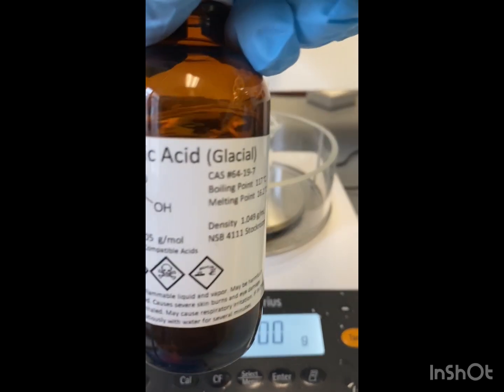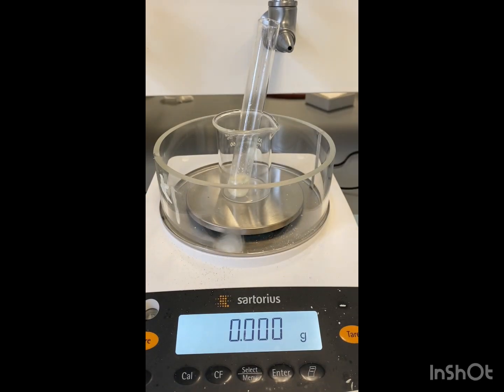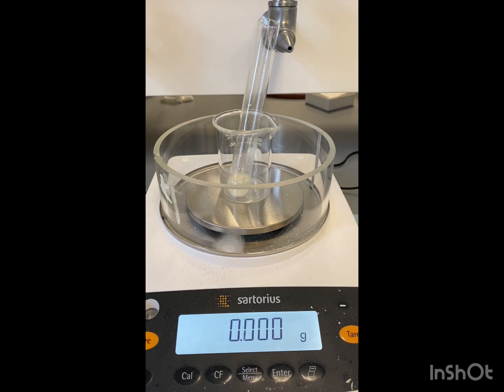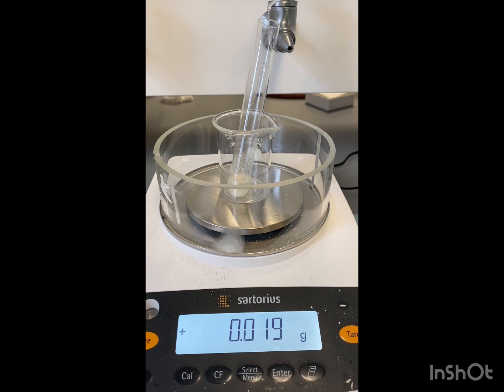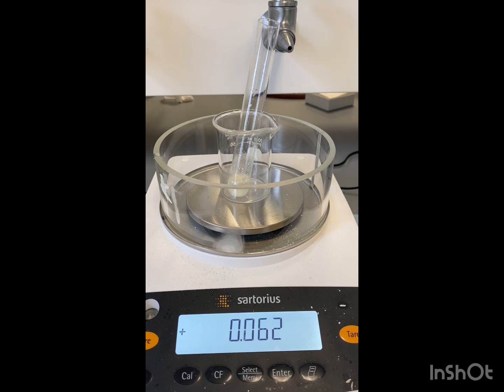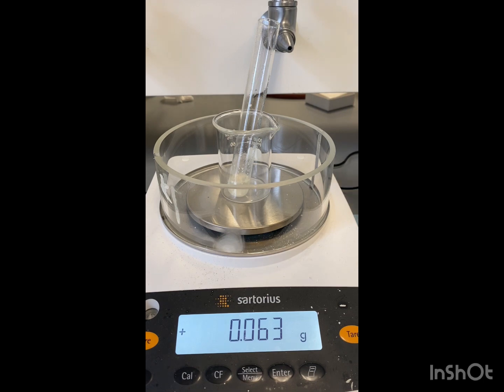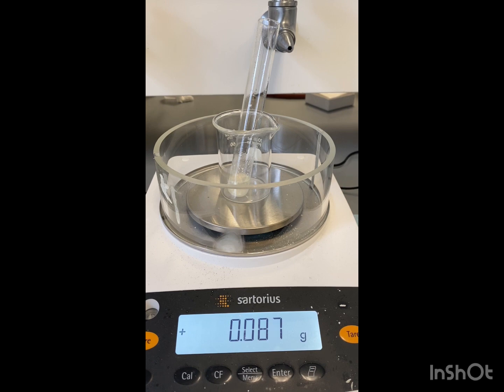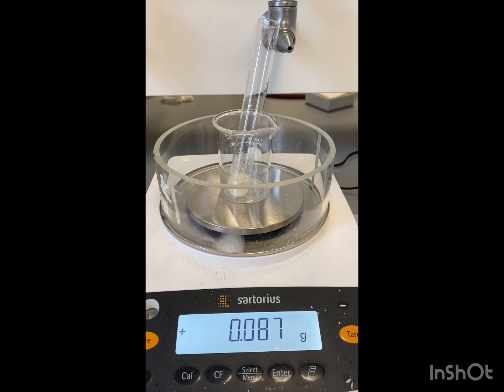Now we're going to add 1.1 millimoles of glacial acetic acid. Be extremely careful because this is very corrosive. We've already done that calculation. About four or five drops is all you need. Go ahead and record that mass.